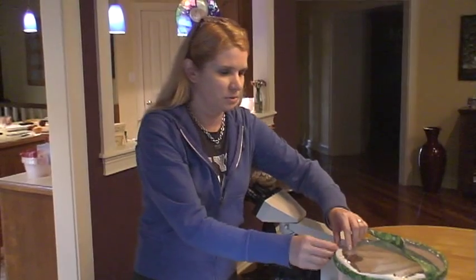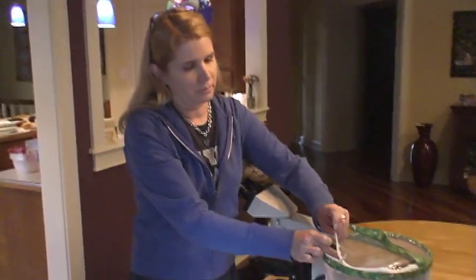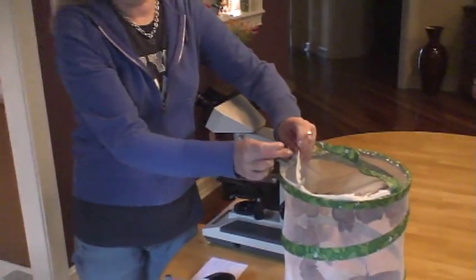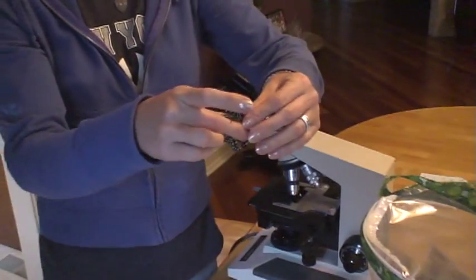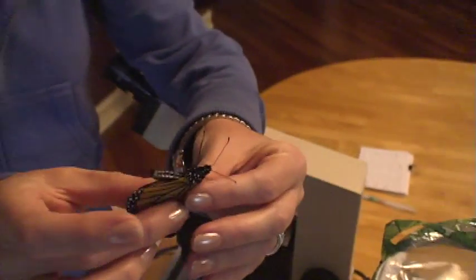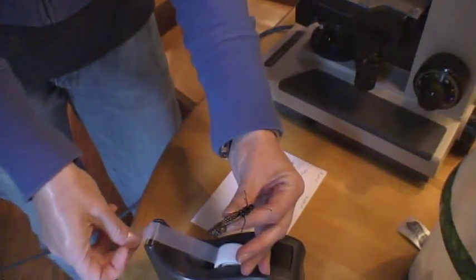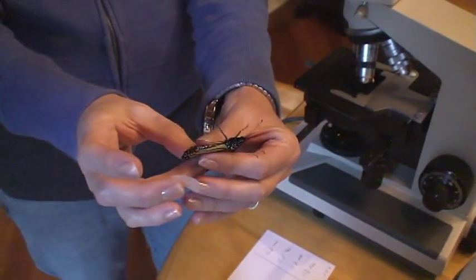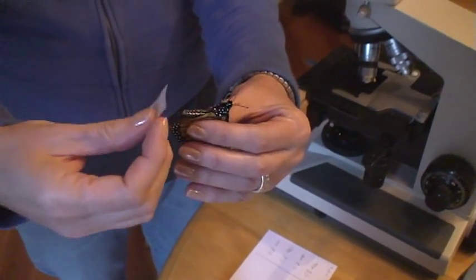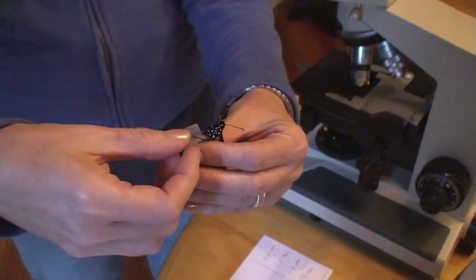What I do is I grab one butterfly so that I get both wings, and hold it firmly but gently right behind its thorax. Then take a piece of regular scotch tape and just stick it along its abdomen.